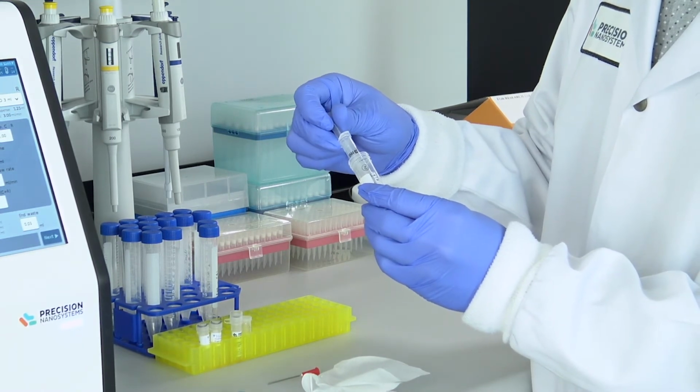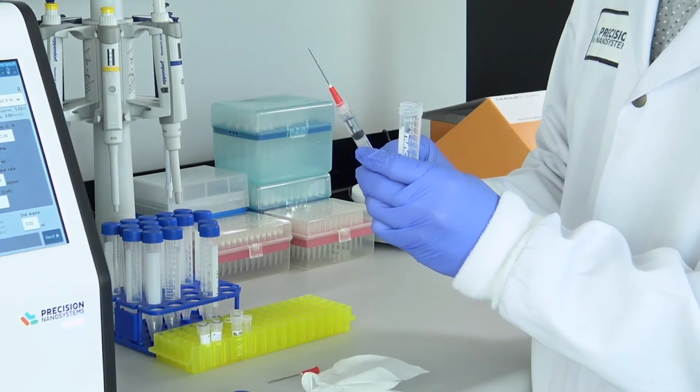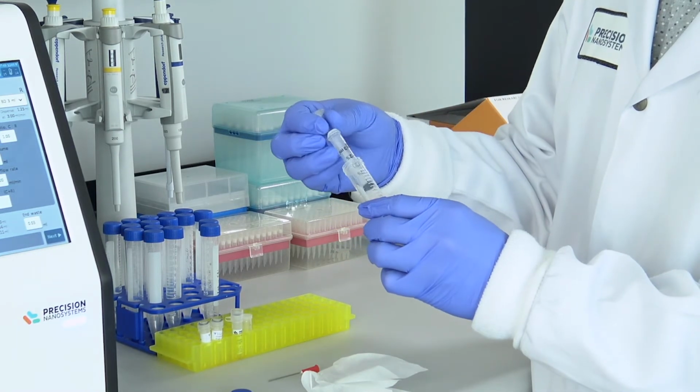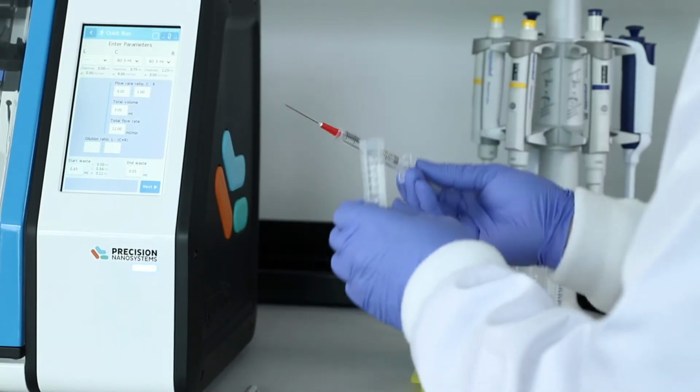Instead, new users can get up to speed very quickly, and parameters can be transferred between users or to other departments or between collaborators, so researchers can concentrate their efforts on the multitude of other activities that are crucial to developing a vaccine or other nanomedicine.